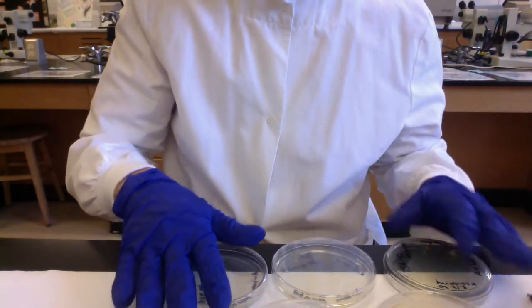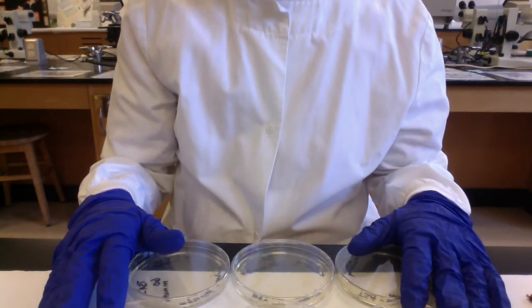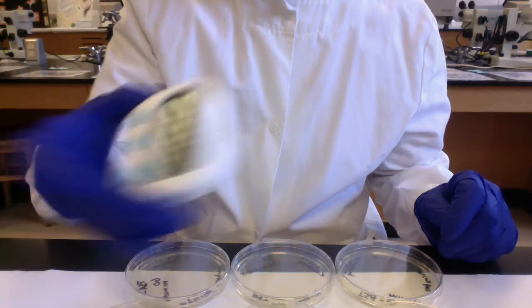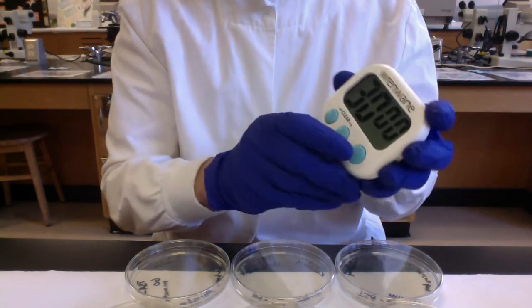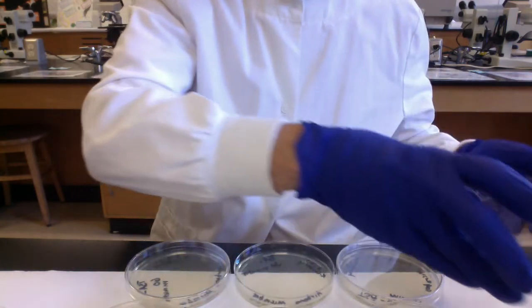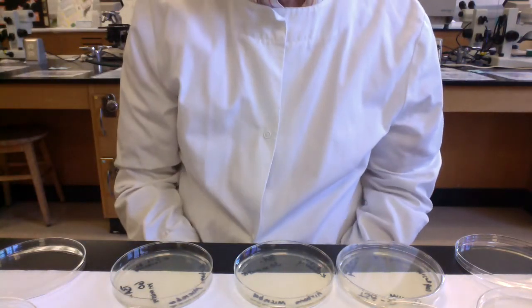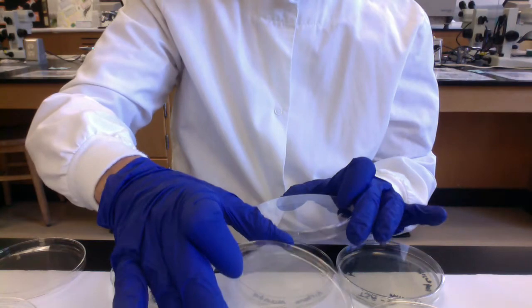Okay. So I'm not sure if you can see this, but I've got all 6 of my plates face up on my bench, and if we were doing this as a team, one of your colleagues would be the timer. So I've got my timer right here, and I've got it set for 30 minutes. So when I first start the timer, like right now, I'm going to take the lids off the 30-minute plates, and I'm going to take the lids off the 60-minute plates. Okay? And then we'll actually do this experiment. We'll actually let it run right now. So when the timer goes off at 30 minutes, I would put the lids back on the 30-minute plates so they're no longer being exposed.